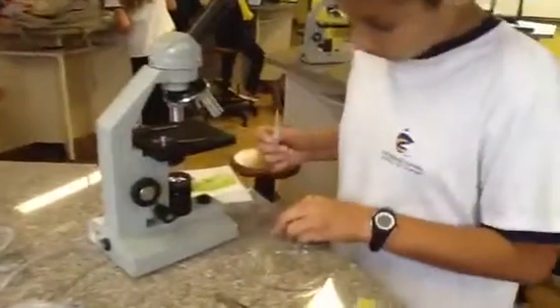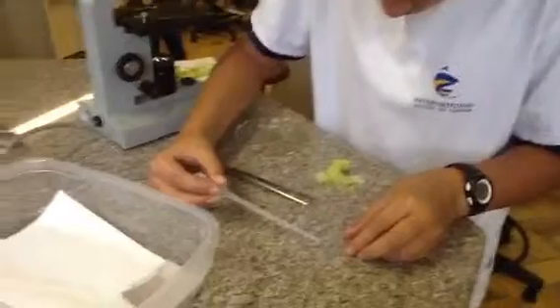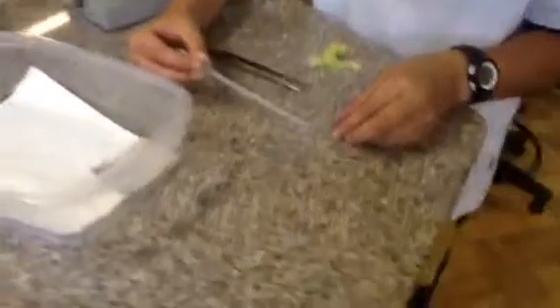So now that we have our pipette filled with water, we're going to squeeze a bit all around our lettuce piece. There's a big bubble of water right around the lettuce, and then from our paper we're going to take our cover slip and then just put that on top. There.